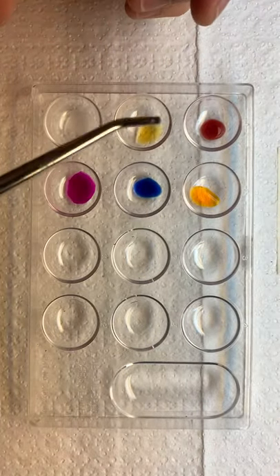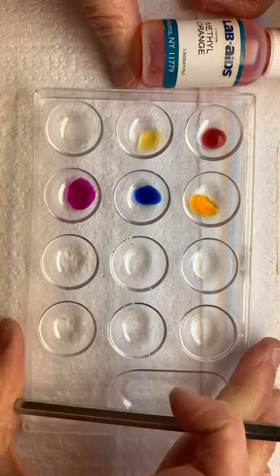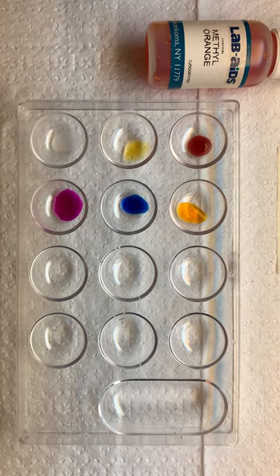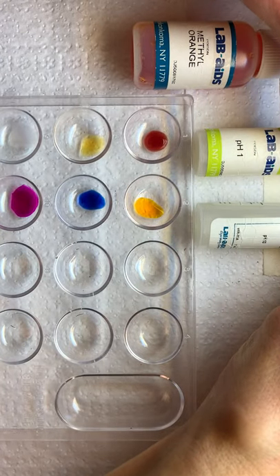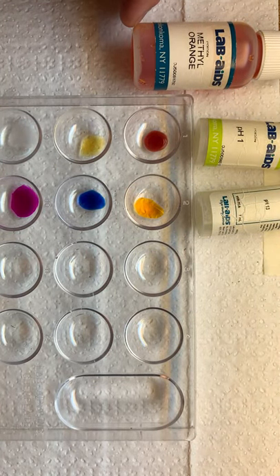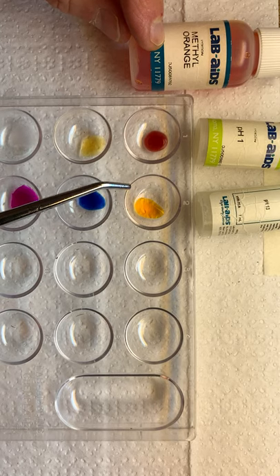Remember, we put methyl orange in the first two wells. This column has pH 1 and this column has pH 13. The first one we're going to do is methyl orange in these two wells.